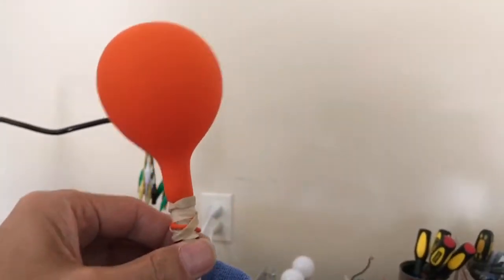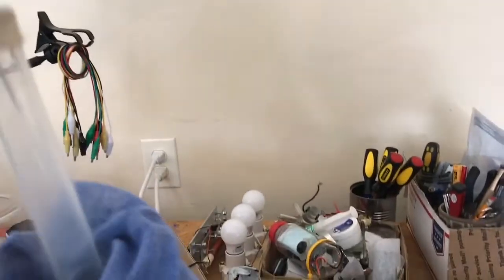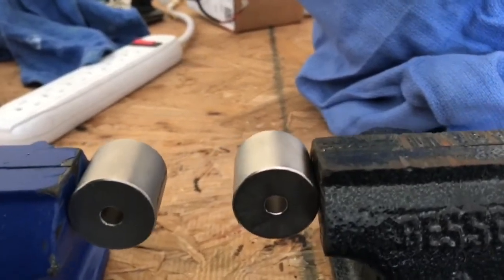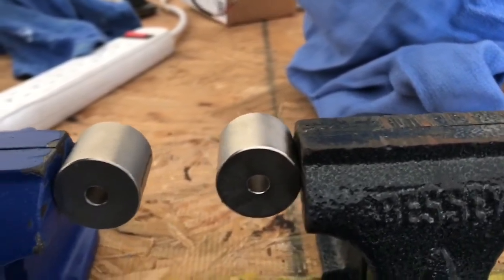Here's what the liquid oxygen looks like - it's a blue liquid. Now we're going to take the liquid oxygen and demonstrate its magnetism by sticking this tube between those two strong magnets.